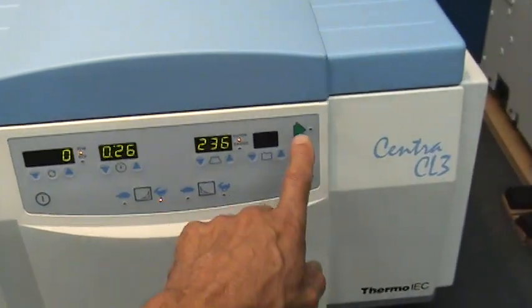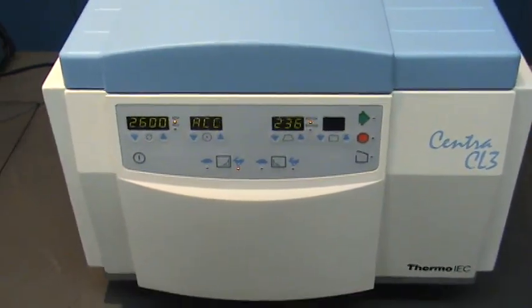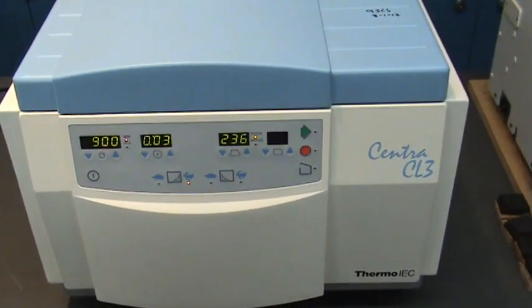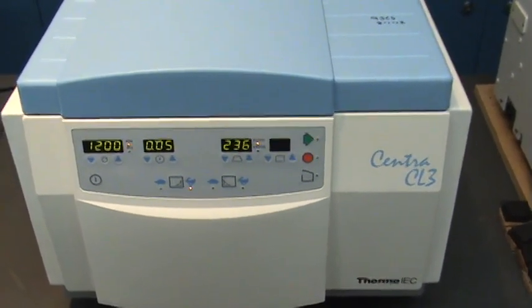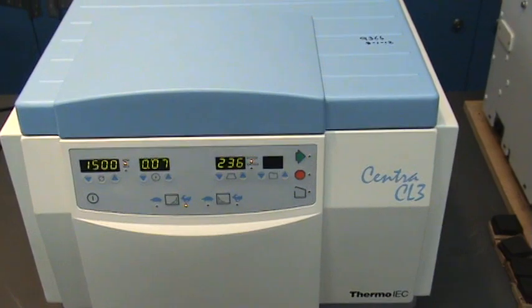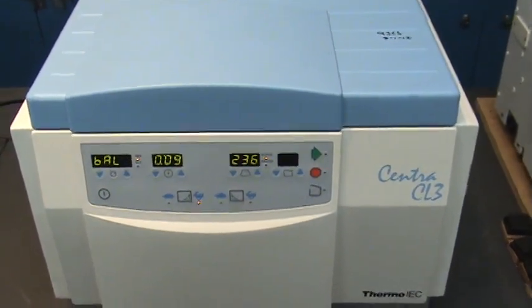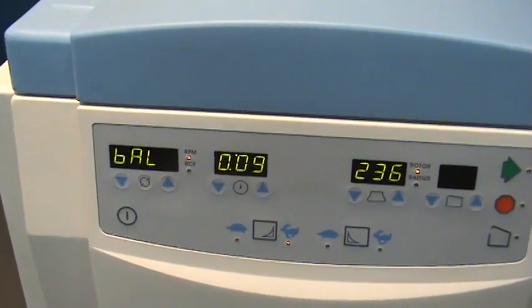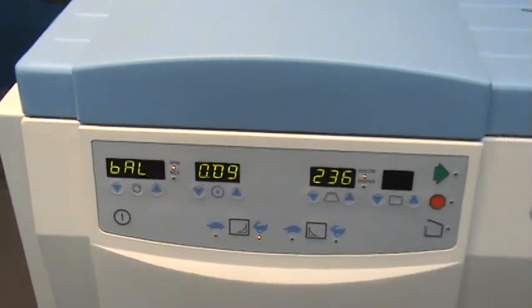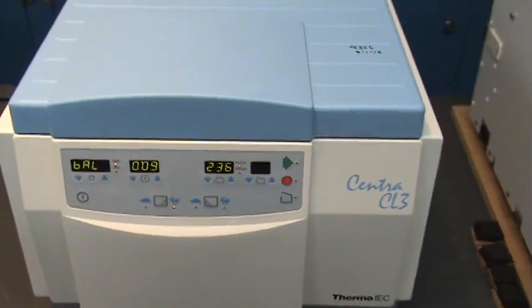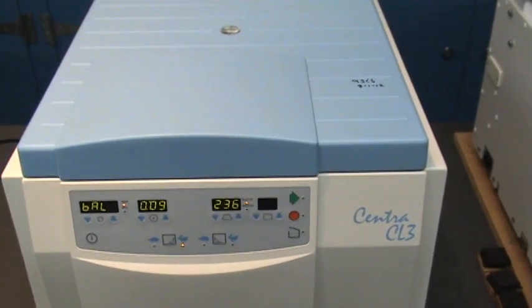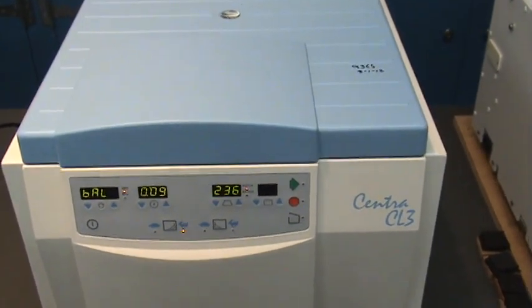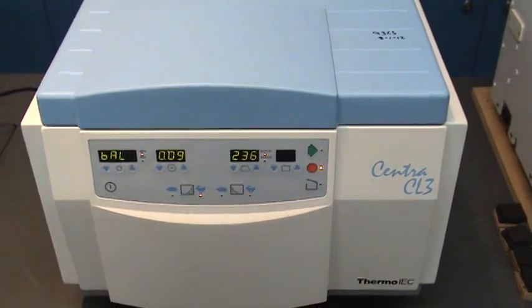If we try to run this centrifuge now with that imbalance set at 2600 RPM, you'll see that it attempts to bring the speed up and quickly goes out of balance and shuts itself off. It's simply too much mass for this particular automatic balancing mechanism to tolerate.